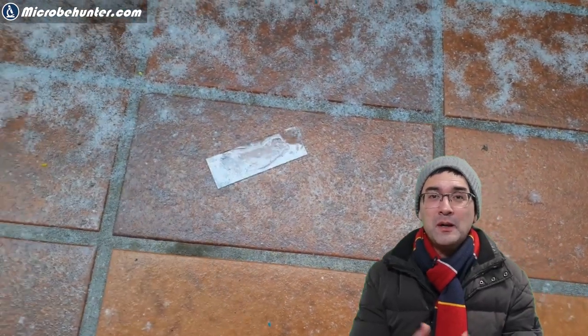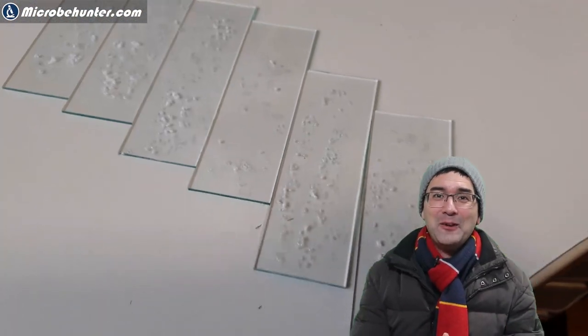So I'm making a permanent slide of snowflakes. That's actually quite something new. I decided simply to place it on the floor.